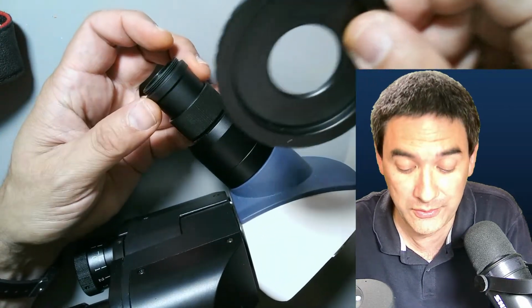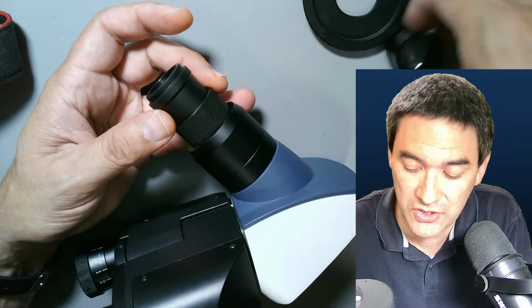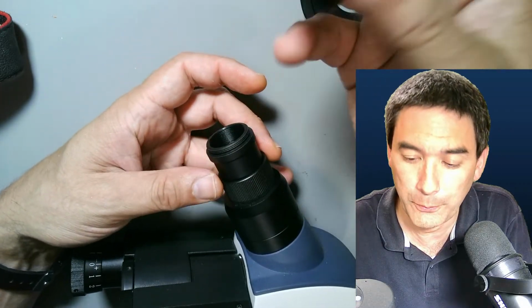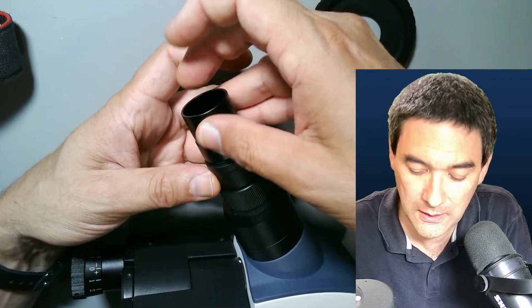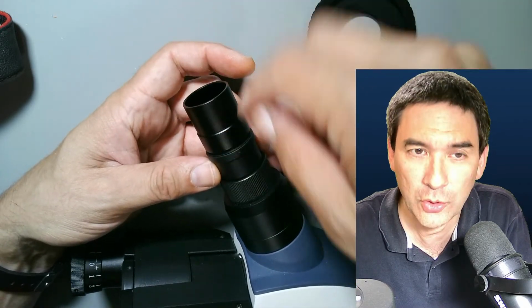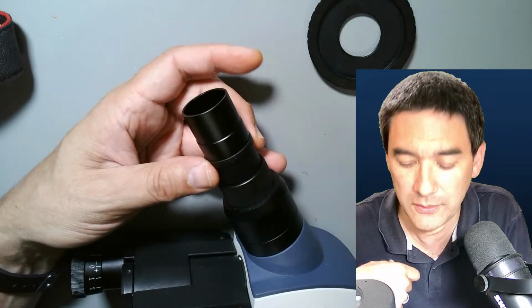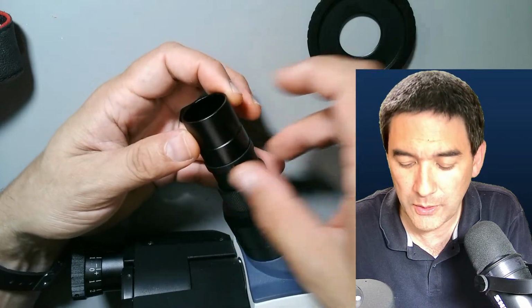You have to try it out, okay? But again, I need to say this only works if you actually have a photo port that allows you to directly connect a C-mounted camera, okay? And you've got to check, because you might not know that the top part here can actually be removed. Okay, so this is just something that I want to share.